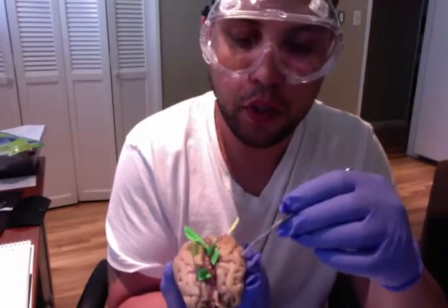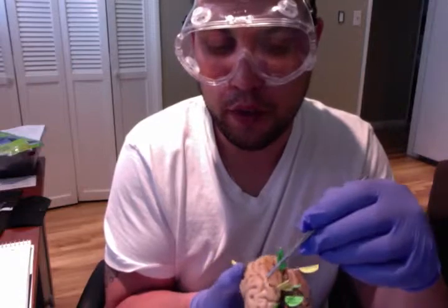We also have what's called a gyrus. The gyrus are ridges on the surface of the brain. They're an outward fold, almost looking like somewhat of a hill, shaping the brain. And the gyrus is believed to increase in the number of foldings in order to support the neurons within it. So we have our gyrus here, and you can see that they are somewhat like little hills on top of the brain.